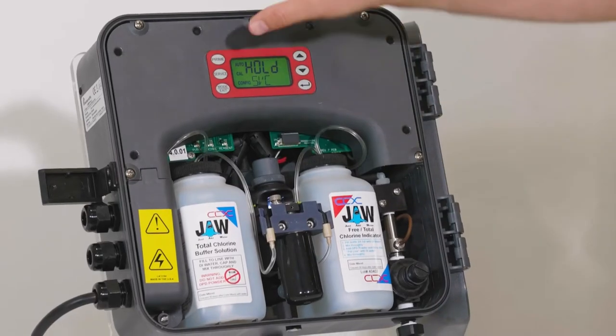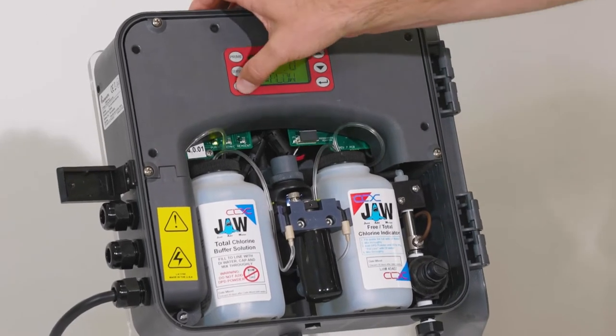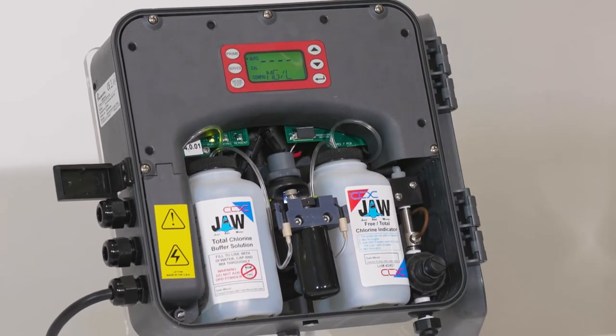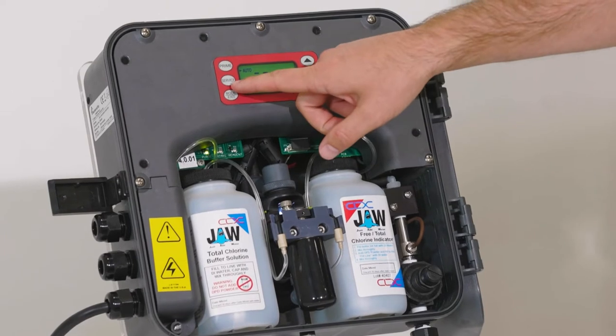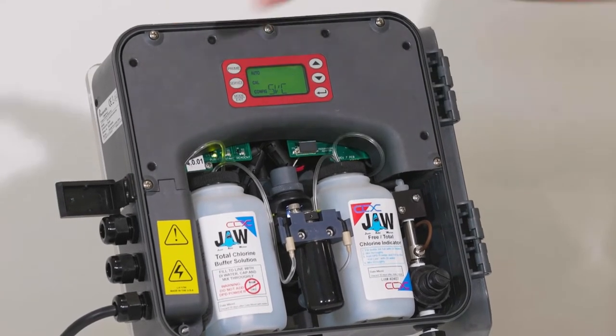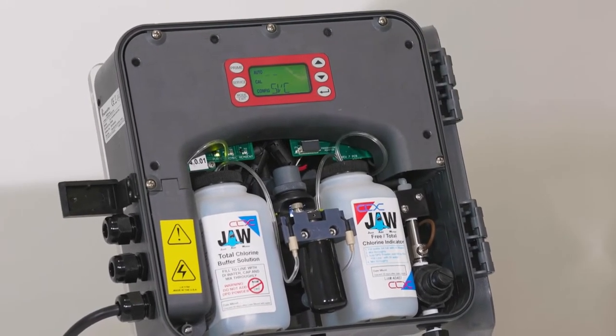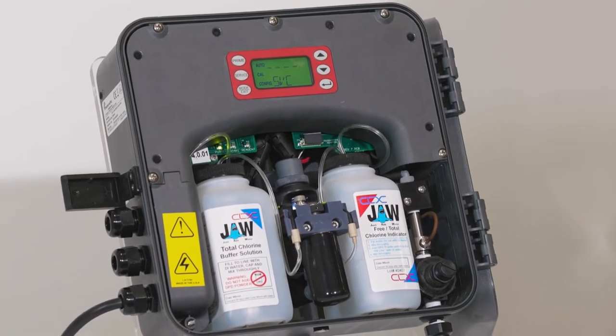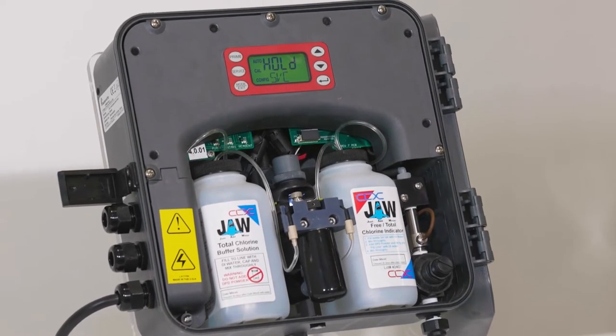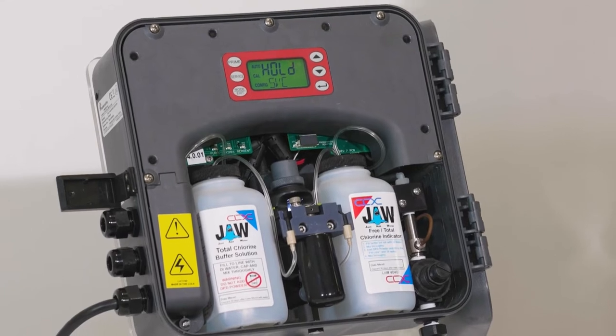The first thing you're going to want to do when you come to the analyzer is to put the unit into a hold mode. You're going to press the center button on the left which says service. After you wait a few seconds the words hold will come up on the screen and that means that your analyzer is in hold mode. There's no water going in so you're safe to go ahead and change the reagents.